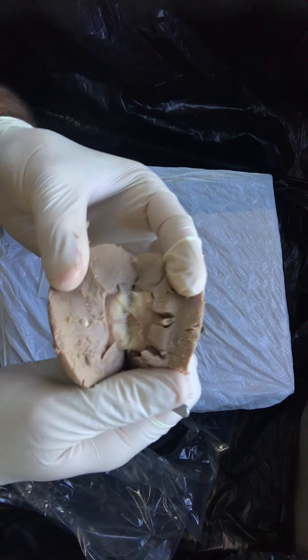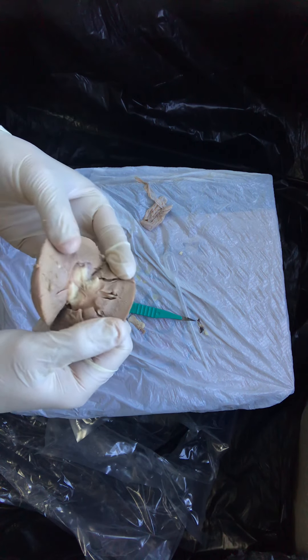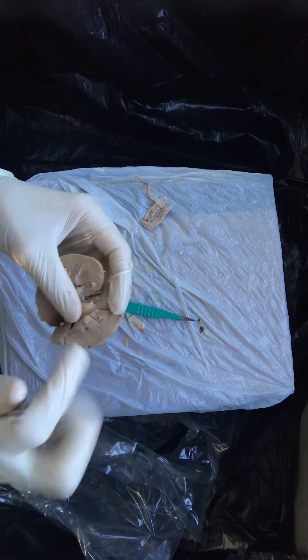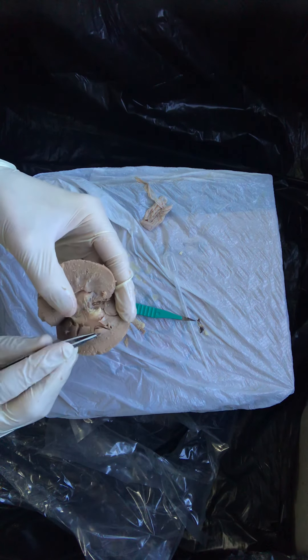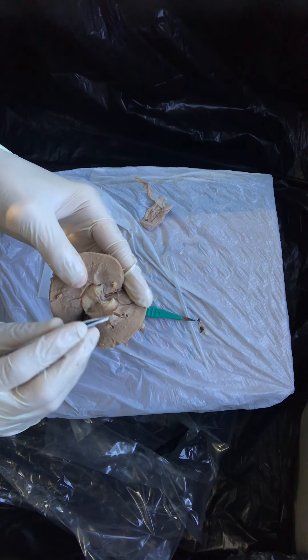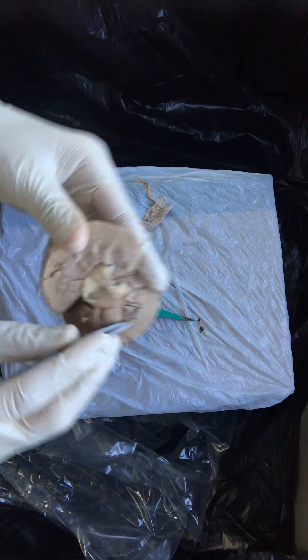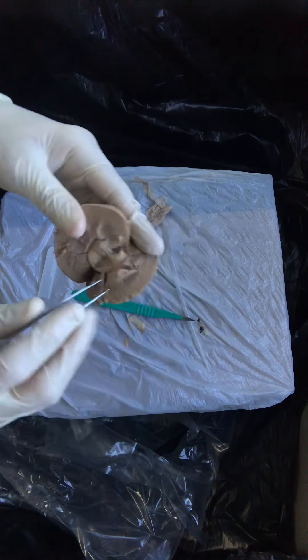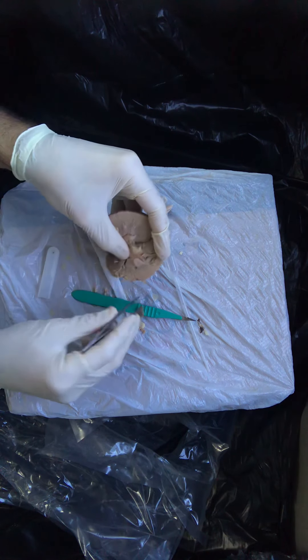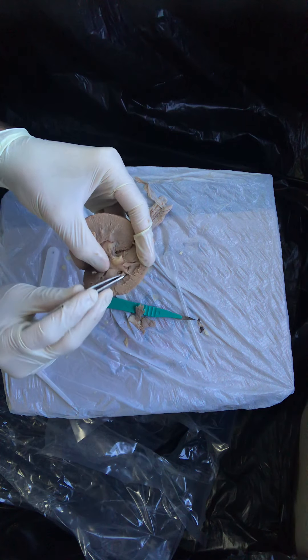These cracks that have formed are not something that I did with my scalpel. There's a normal, natural, anatomic difference between what we call the parenchyma of the kidney — which is all the cells of the cortex and the medulla — and the collecting system. There's a natural separation between that tissue in the collecting system. So I'm going to get a little bit aggressive with my dissection and peel away some of that parenchyma tissue on this side of it.